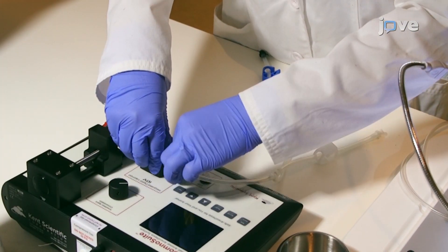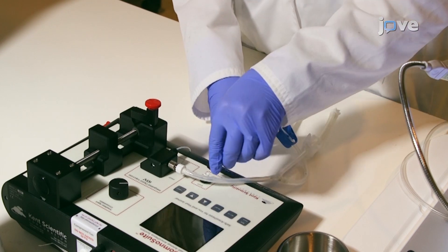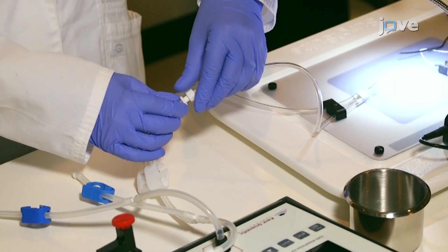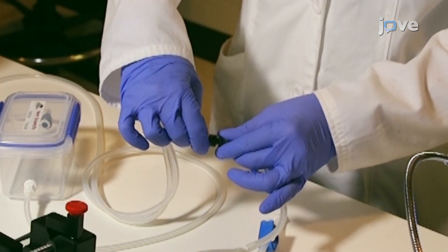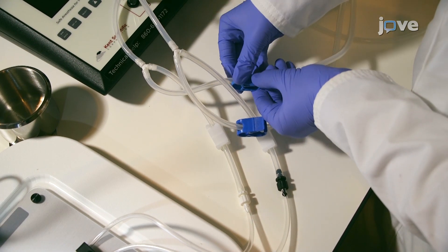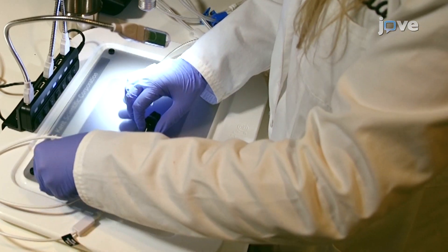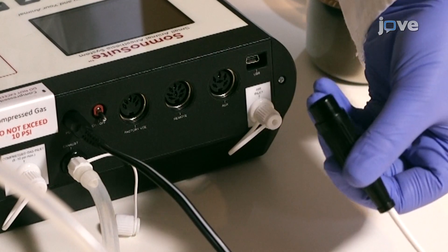Next, connect the delivery tubing to the anesthesia system. Use the color-coded clips to designate the branches for the nose cone and the induction chamber. Open the clamps to direct airflow to the chamber. For physiological monitoring, connect the pulse oximeter paw sensor to the back of the low-flow anesthesia system.